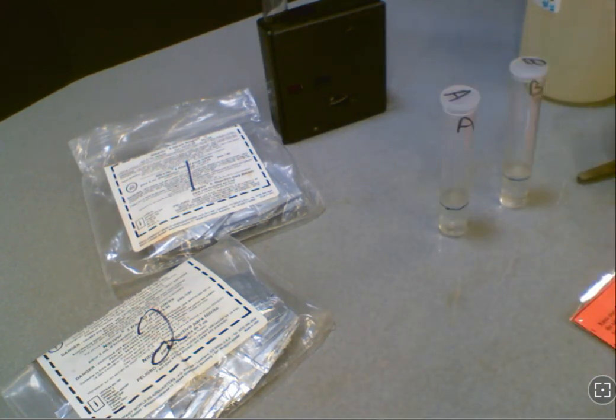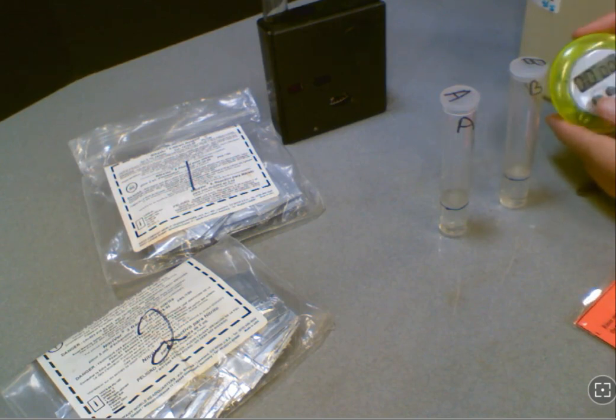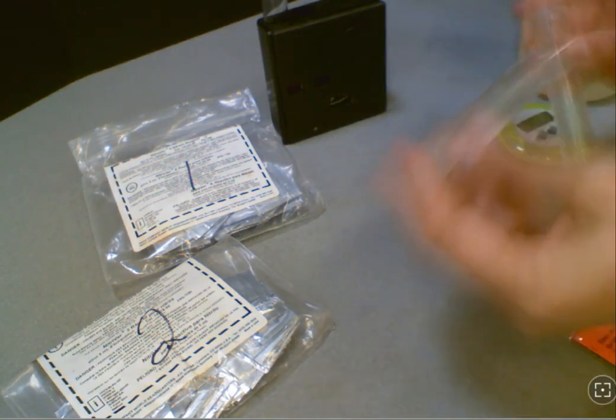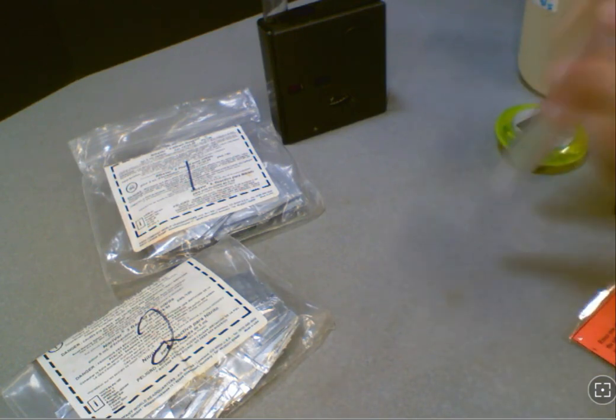Important to note that while you're waiting for that three minutes you also need to shake the container, so go ahead and get a timer and start it for three minutes and then you can go ahead and mix your tubes for that time. This is helpful to have a couple students man the timer and a couple to mix in the process.